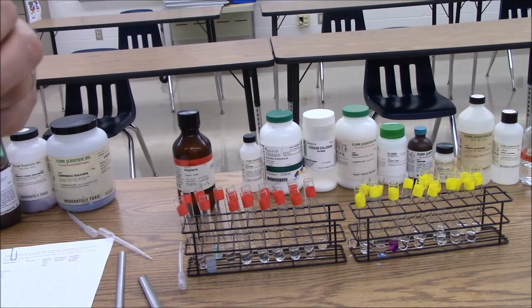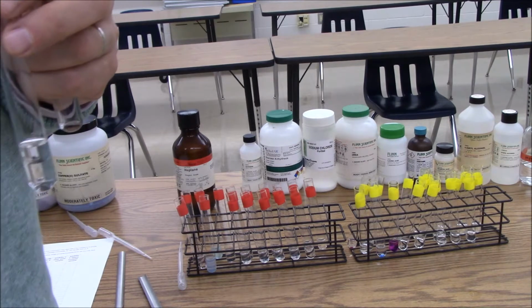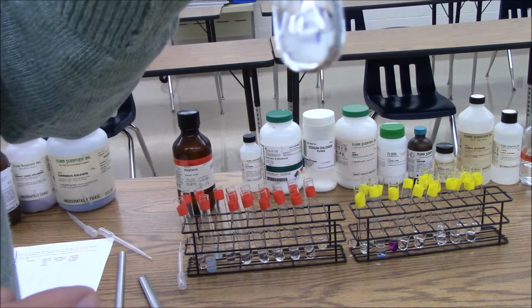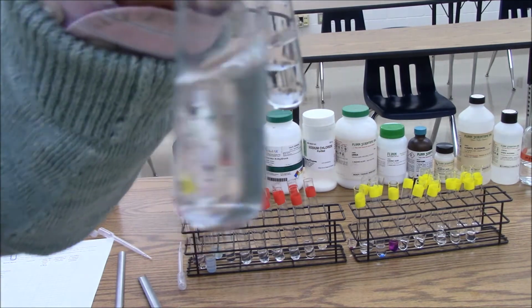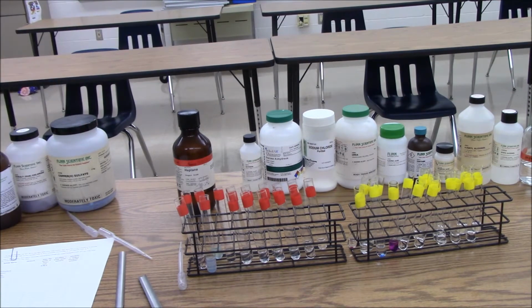Heptane is a liquid. So when we're dealing with two liquids, we'll often use the terms miscible and immiscible, which is Latin for mixable and not mixable, but they mean the same thing as soluble and insoluble. So here's my water, and I'll put this up to my sweater, and you can see there's a boundary where the water and the heptane have not mixed. Whichever one is on top or the bottom will depend on density. In this case, it happens to be the water. If you look in the hexane, there's no boundary. So the hexane and the heptane were completely miscible in each other.